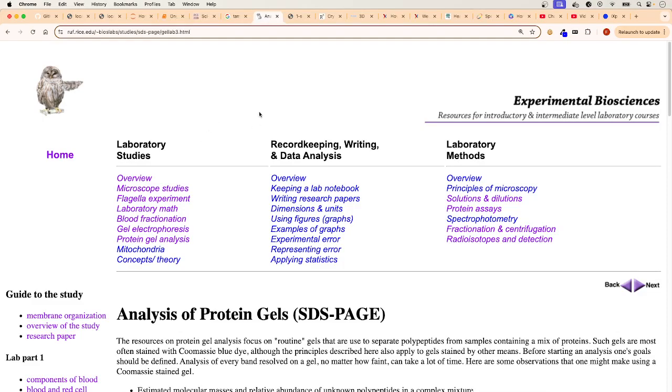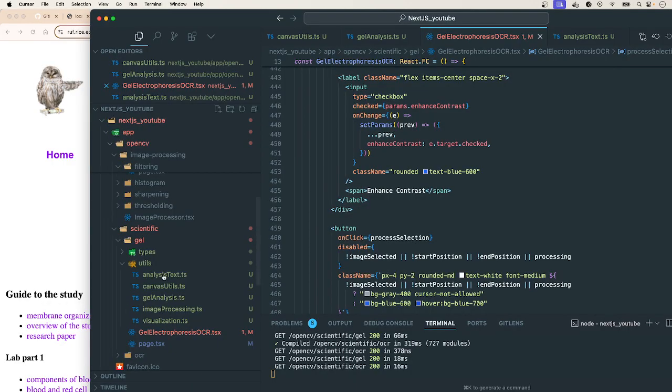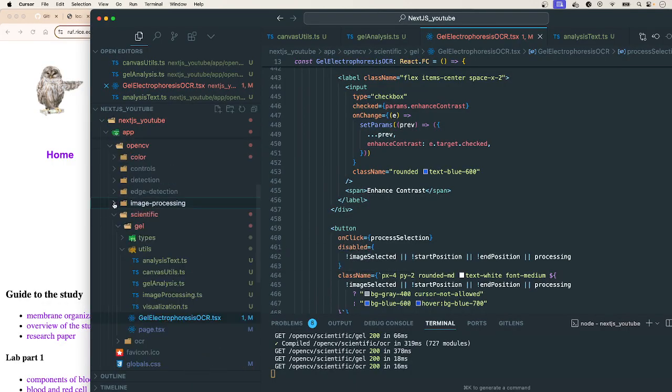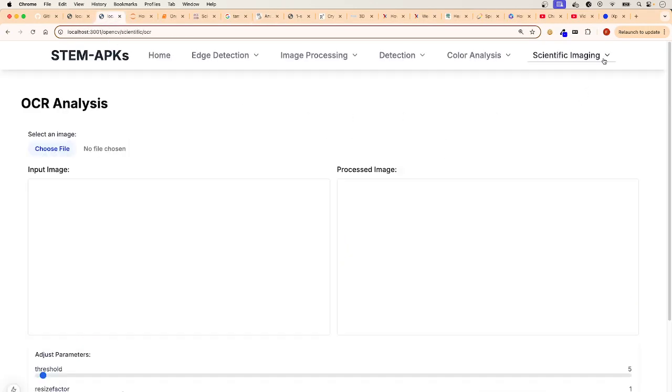Welcome to another tutorial. In the last tutorial, as you remember, I had some issues with getting my file going, and this is what the problem was. I had created a folder, this gel folder. I added it to OpenCV by mistake, when in reality it should have been inside the scientific section next to OCR, because if we look at the drop down, that's what they are. I created basically another drop down instead of just making it part of the scientific imaging. So now it's working.